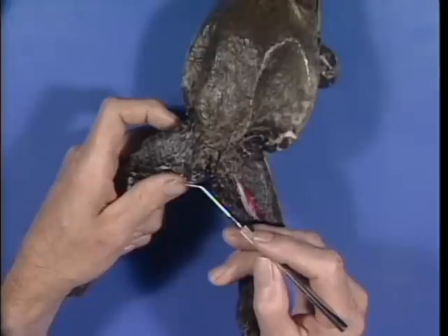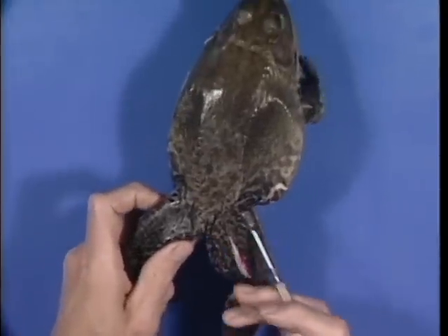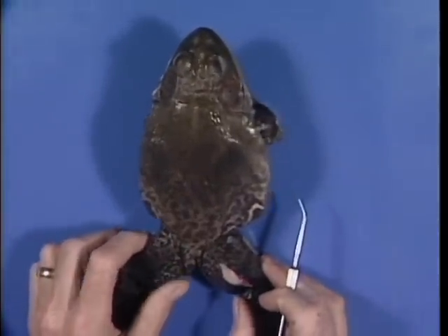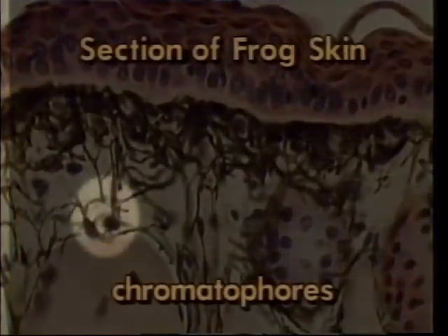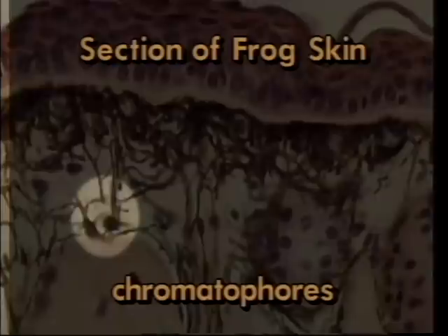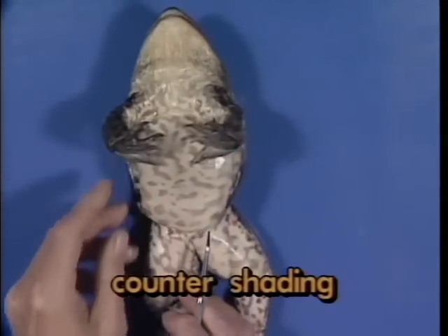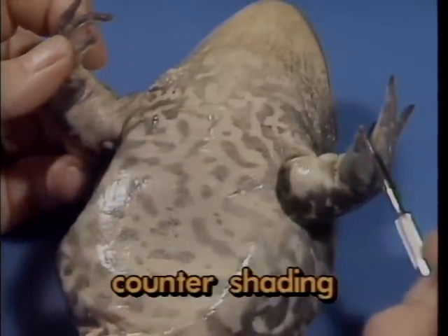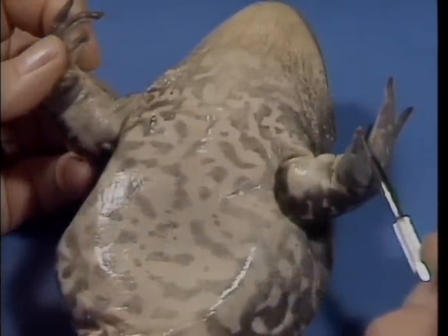Now let's take a look at the skin of the frog. In life, the dorsal surface of the skin is green and brown because of pigment cells called chromatophores. This color helps the frog blend in with its surroundings, making it less easily seen by predators. The ventral surface is off-white and represents a case of counter-shading. Counter-shading makes the swimming frog less easily seen from below when the sky is light.